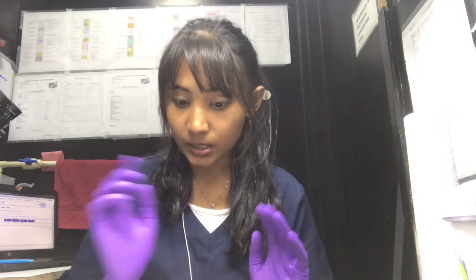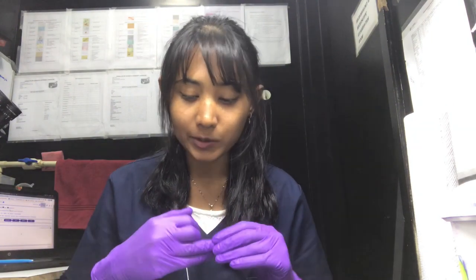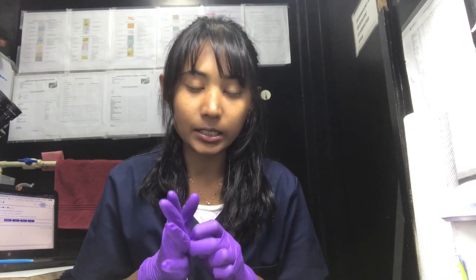So we did see a lot of interesting things today. Let's summarize: the urine had high protein, a high amount of microalbumin, and a high number of leukocytes. In cytology, we saw lots of cocci — I'm suspecting gram-positive cocci, which are commonly seen in these cases. If you want, you can always go ahead and do a Gram stain.